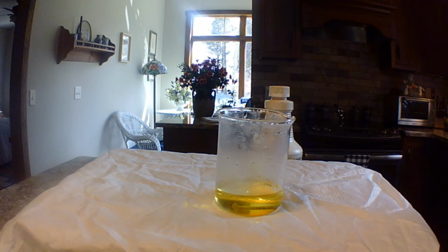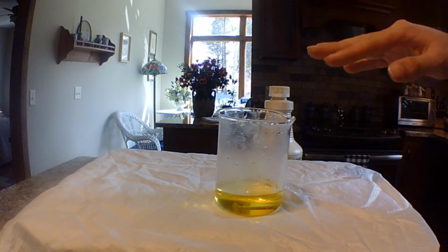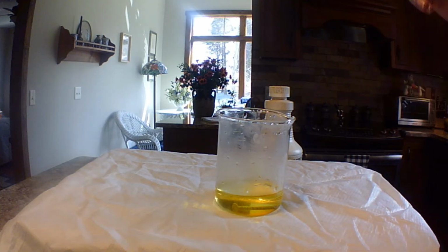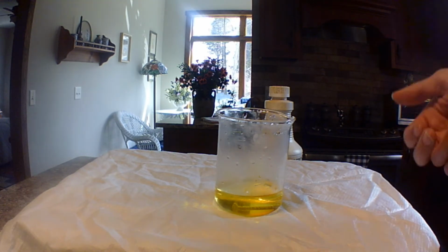And notice the rust is almost gone. Slowly dissolving away. Because we started with rust, which the compound for rust is Fe2O3, and then we combined it with 6HCl, which is hydrochloric acid, and we got, it's turned into 2 FeCl3 and 3 H2O.